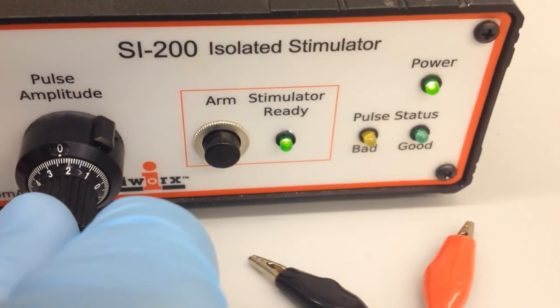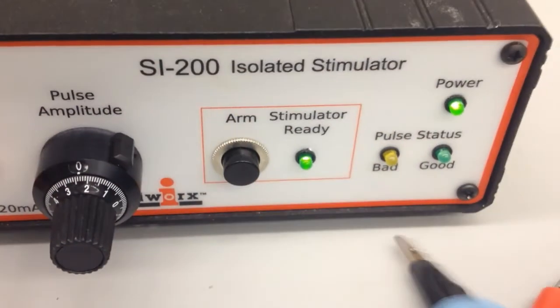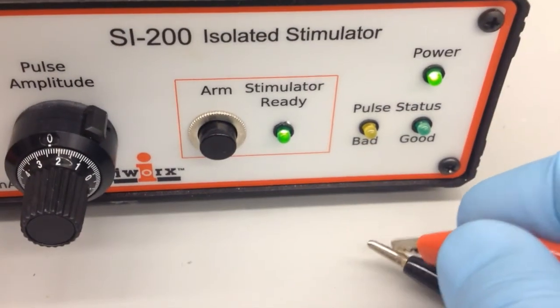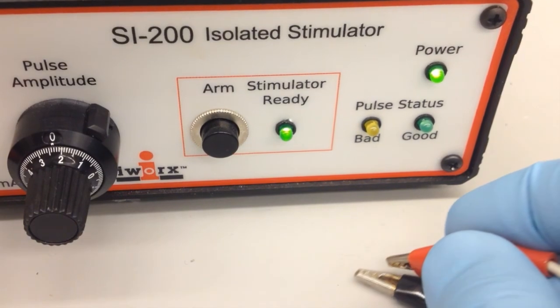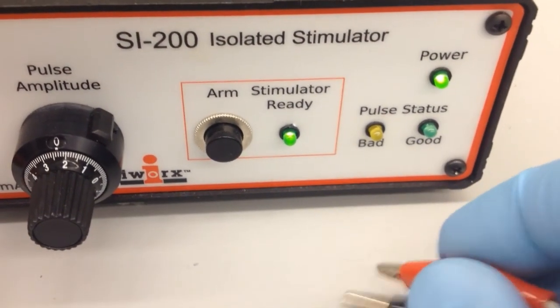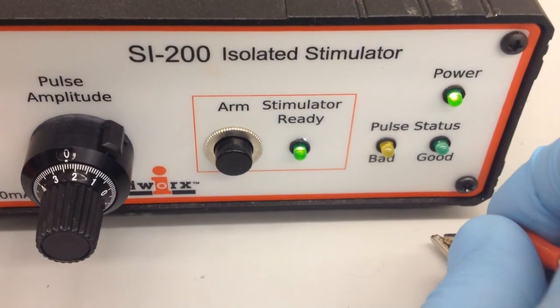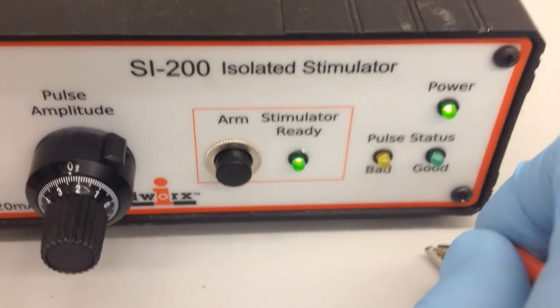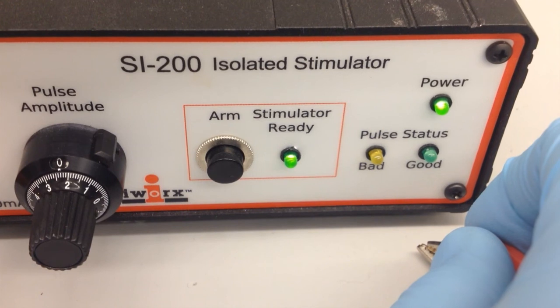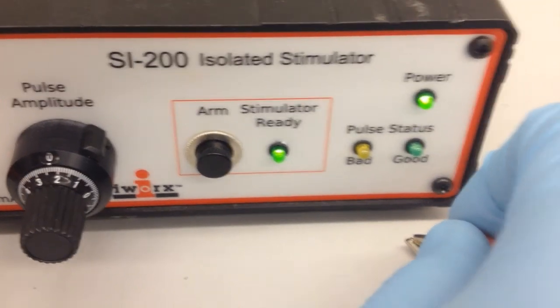At this point the stimulator is not delivering a current, or is delivering a current with an amplitude of zero milliamps. If you increase the current to something other than zero, the yellow light will blink indicating a bad pulse. You can touch the two electrode leads together to ensure that the yellow blinking light turns into a green blinking light, indicating that the correct current is running between the leads.